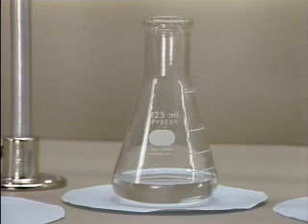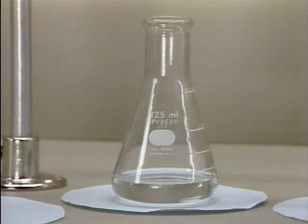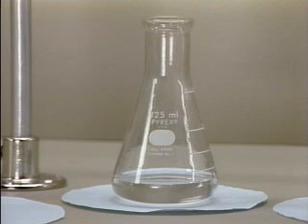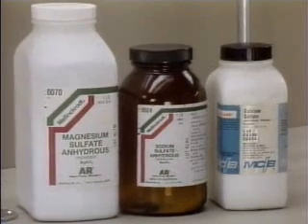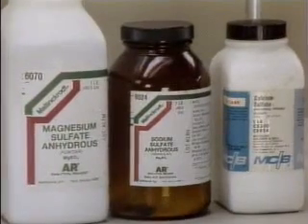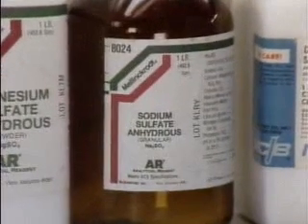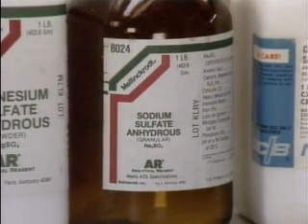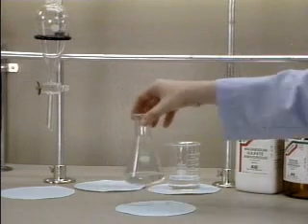Once the separated phase containing the desired compound is obtained, it can be purified. If the material is in the organic phase, there may also be some water dissolved or suspended in it. This water can be removed by adding an appropriate drying agent. The choice of the drying agent depends on the nature of the solute. Because some drying agents are slightly acidic or basic due to the hydrolysis of their salts, care must be taken to choose one which will not react with the solution of the compound that has been extracted. In this case, anhydrous sodium sulfate is added to the separated organic layer, and the mixture is left to stand for a few hours.